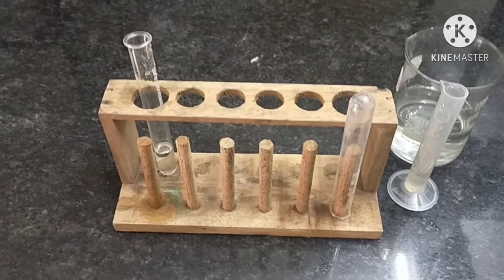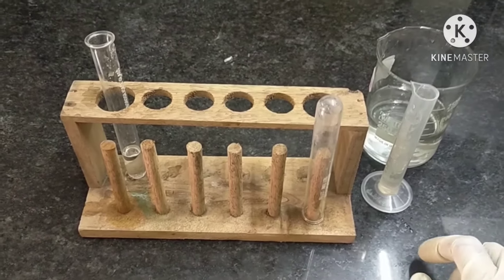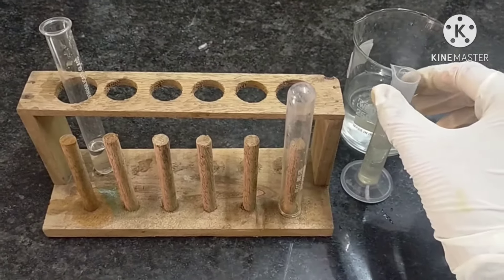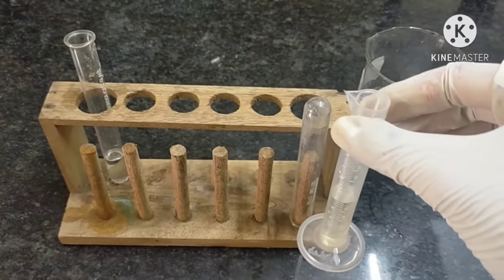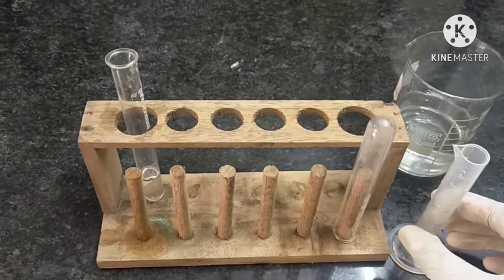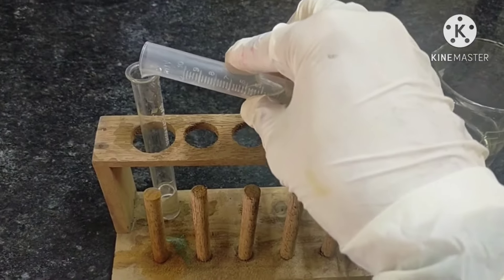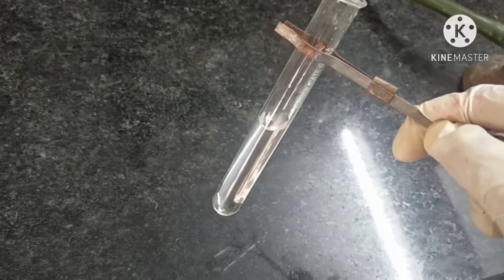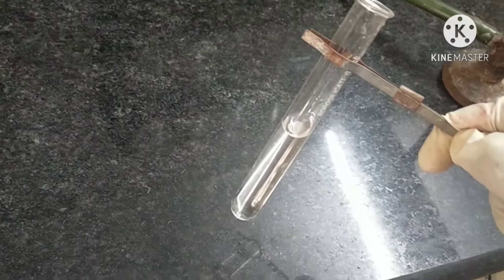After adding 2-3 ml of ethanol in the test tube, now we will add 5 ml of sodium carbonate solution, which I have already measured. Add this solution into the same test tube with the help of the measuring cylinder. After adding both solutions, we will heat this mixture.